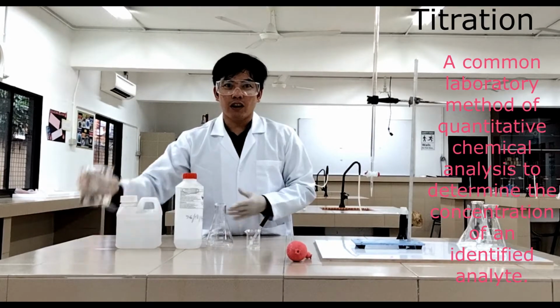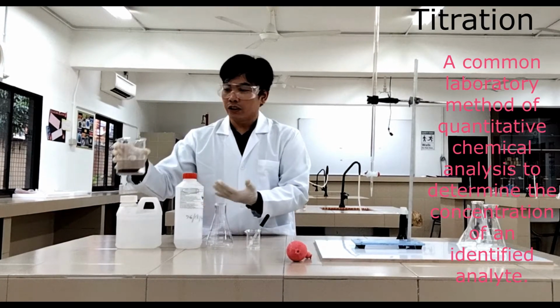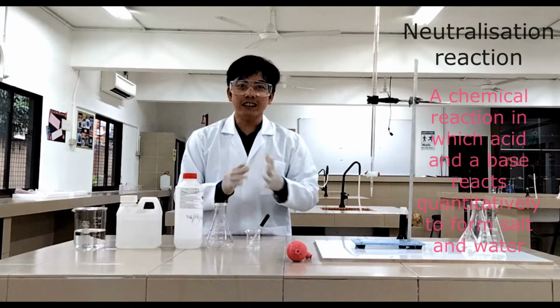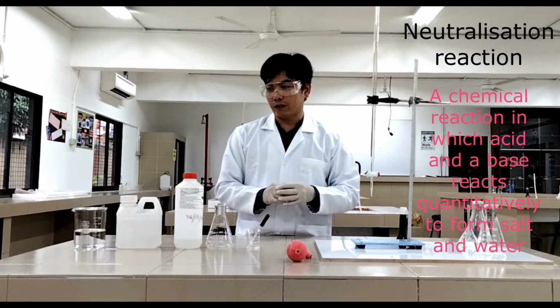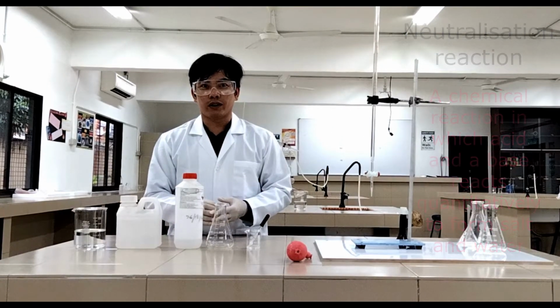Concentration of an acid or an alkali using a known concentration of acids or an alkali. And in this experiment, you will observe a neutralization reaction. Okay, so to begin with, let's identify the chemicals and apparatus that we are going to use.